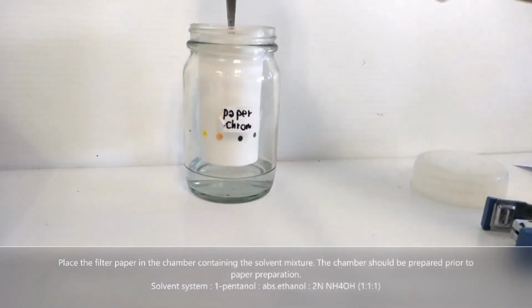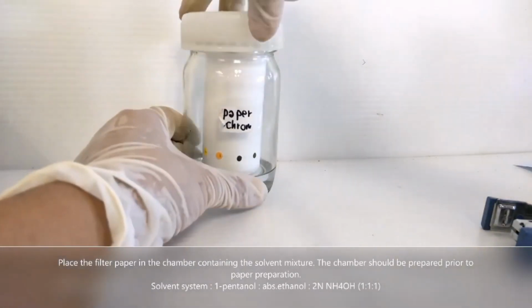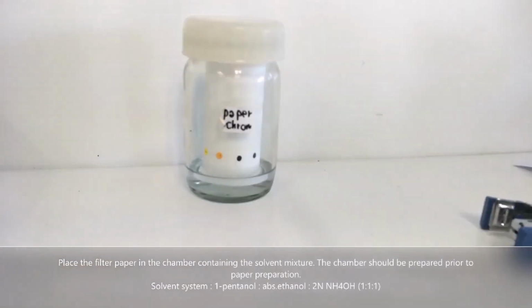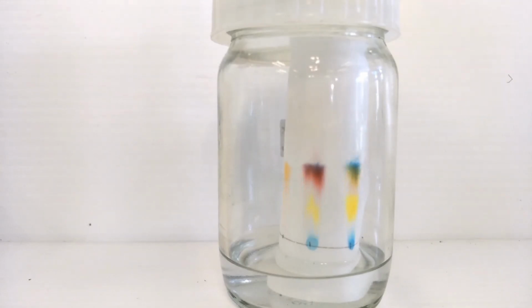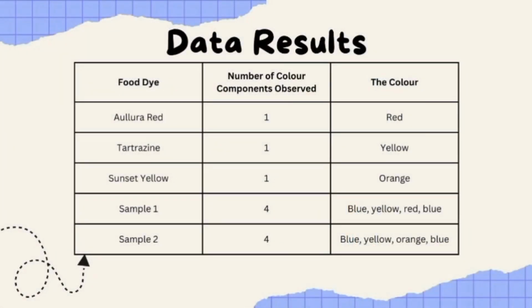After that, place the filter paper in the chamber that contains the solvent mixture. And lastly, allow the solvent to rise up until the solvent front. So, based on the experiment that has been conducted, these are the results of the experiment. So now, let's move to how to calculate the RF value of the food dyes.